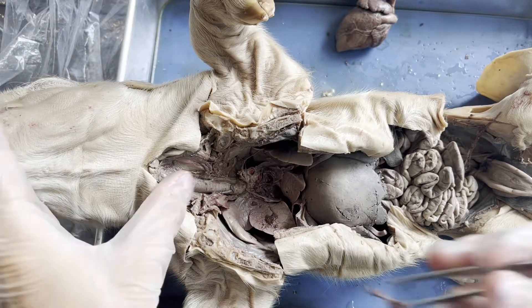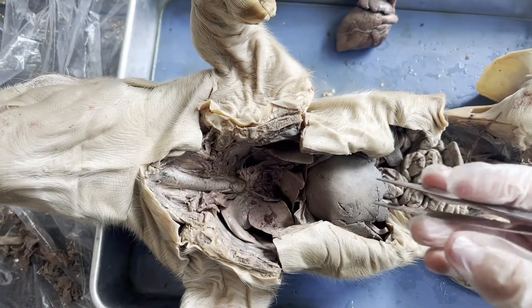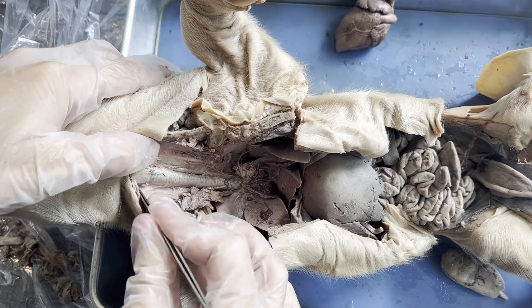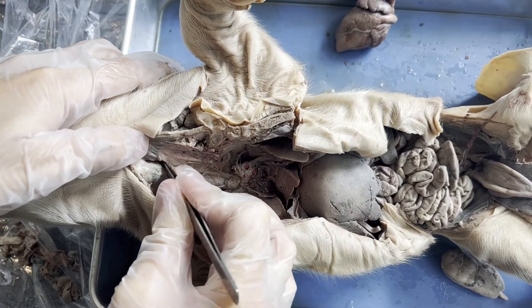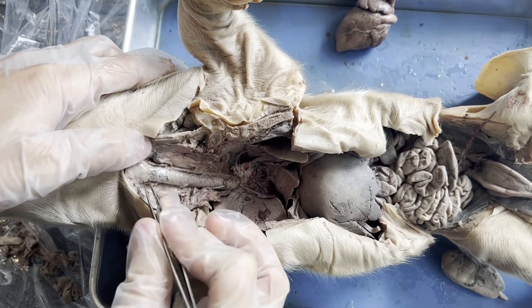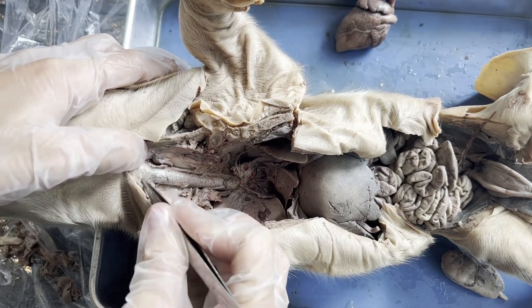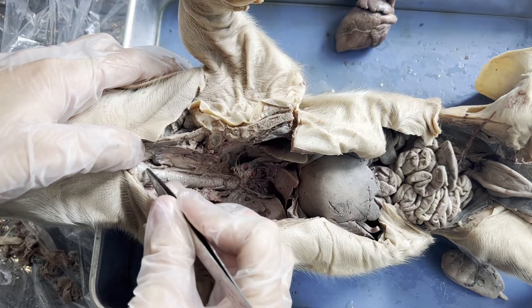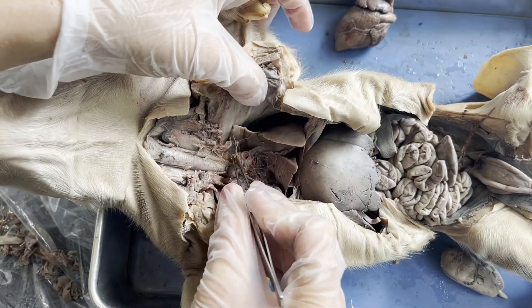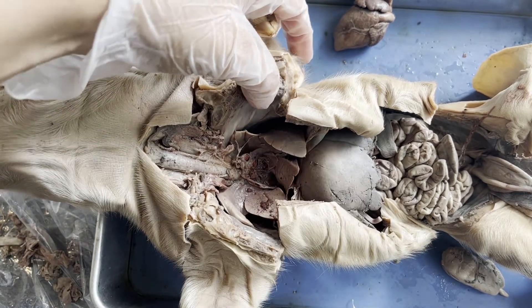I'm going to pull the thyroid gland out officially because I want to be able to see where the voice box, or larynx, of the pig is. At the top of the trachea, you can see that it bulges right up here. Inside this bulge are the vocal cords — so this is the larynx, also known as the voice box. Then the trachea continues down to the lungs.